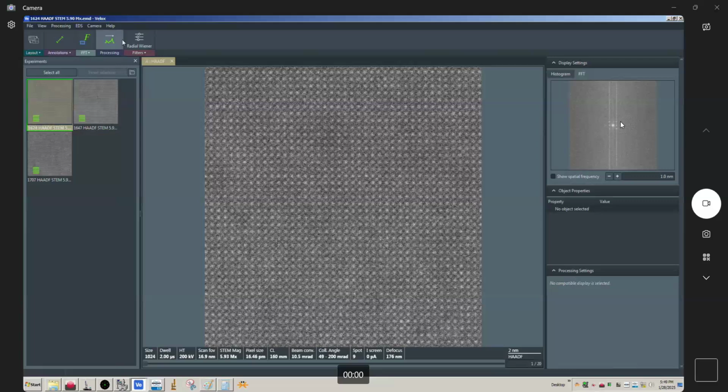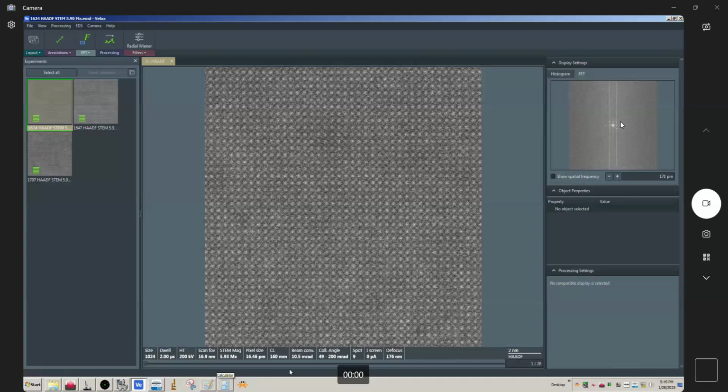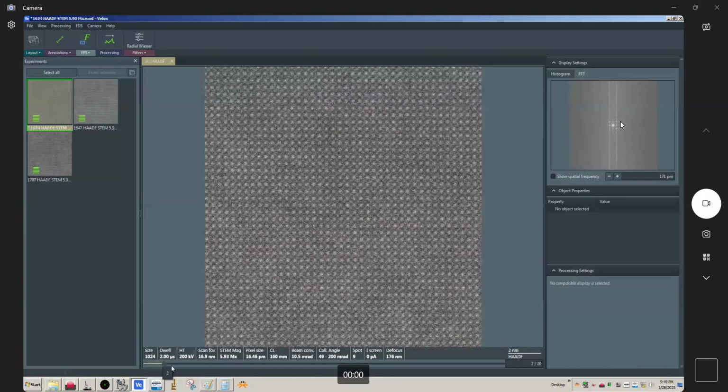And if you look right here, this is the FFT. Of course, we're not seeing a lot of detail owing to the fact that the signal to noise is poor in a single frame, but you can see very clearly that we're not seeing a lot of detail beyond 2 angstroms here, at least in the FFT of a single frame. But anyways, you can see I've got 20 frames here. Now watch what happens as I cycle through the frames.